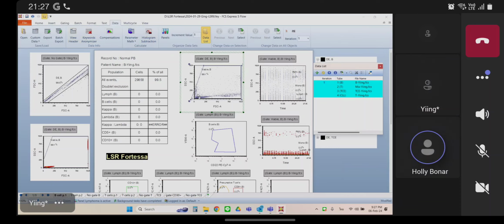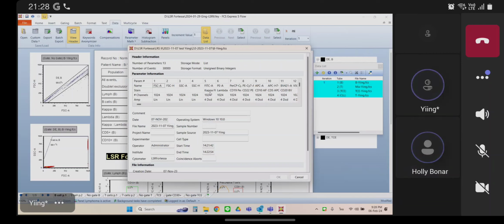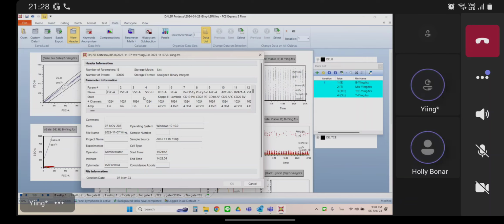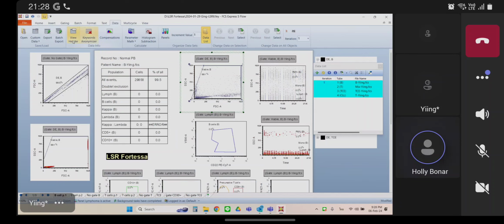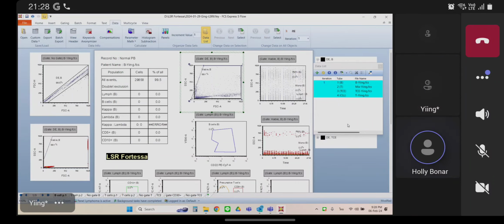Okay, so on this plot, we have side scatter versus forward scatter. Go to view header. Okay, look at the parameter numbers. In this data file, side scatter is parameter 3. And forward scatter is parameter 1. So if we cancel and move down on this plot, see where it says side scatter versus forward scatter? What this plot is actually showing you is parameter 3 versus parameter 1. Which happened to be side scatter versus forward scatter, but it's really showing you parameter 3 versus parameter 1.